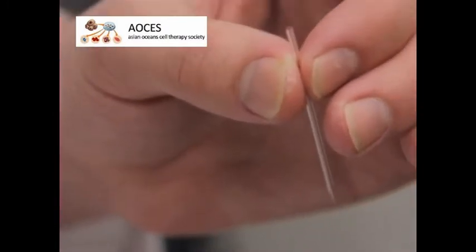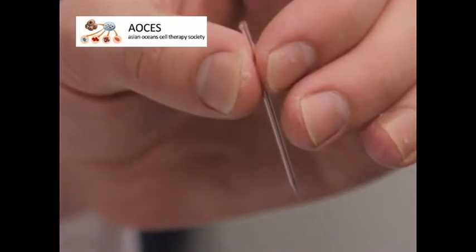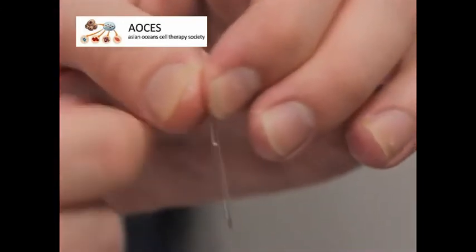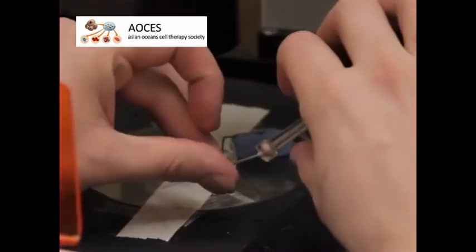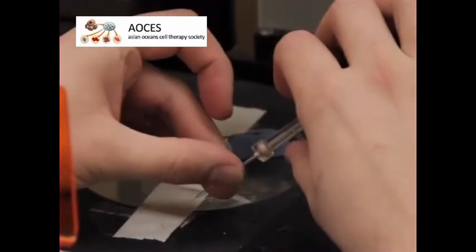After polishing, fill the micropipet with an ionic solution and flick gently to dislodge any air bubbles. Then, slide the micropipet over the electrode attached to a holder.